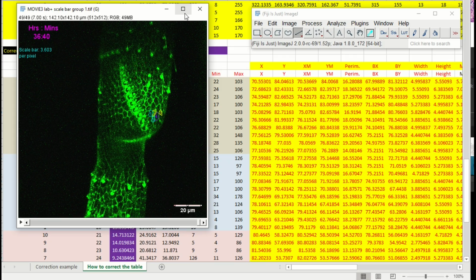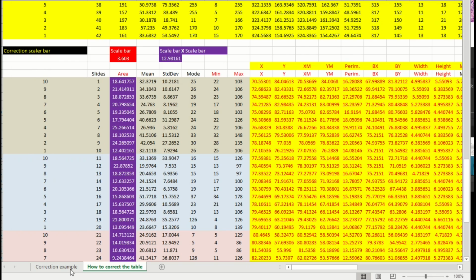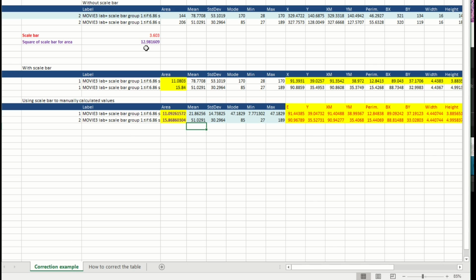I am going to tell you how to solve what happens if you did all the measurements and you forgot to add this scale bar. You are not going to lose any of your data, and I'm going to show you an example. The only thing that you have to do, as I said before, is a simple division.